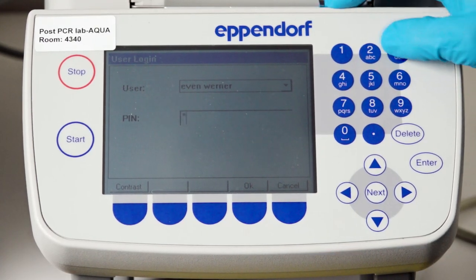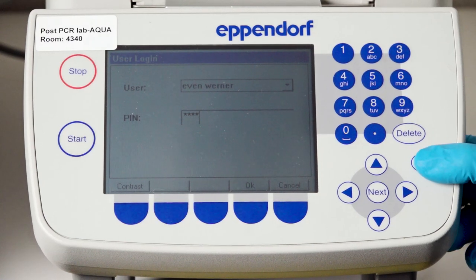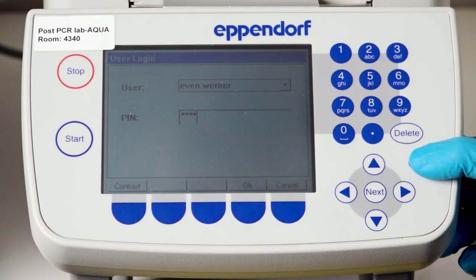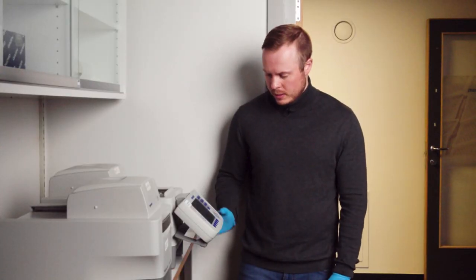You can use the users we have in-house or you can ask the lab technicians to make your own user for you. So then I write in the password and press enter.